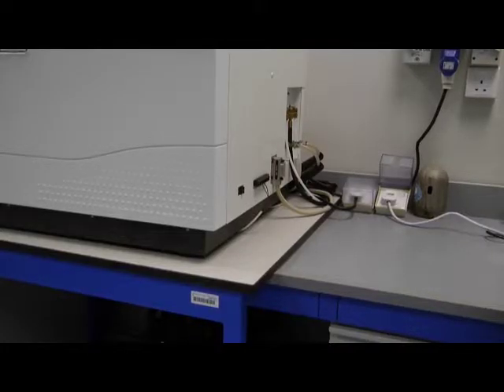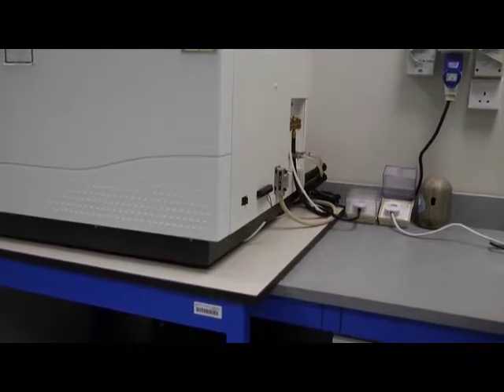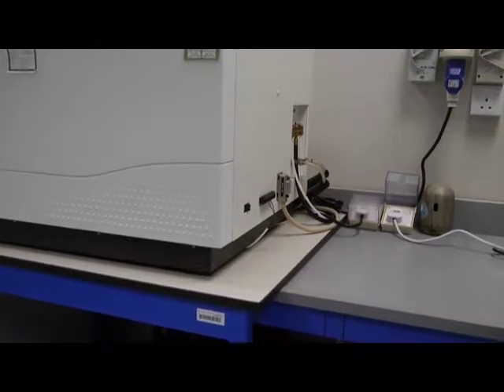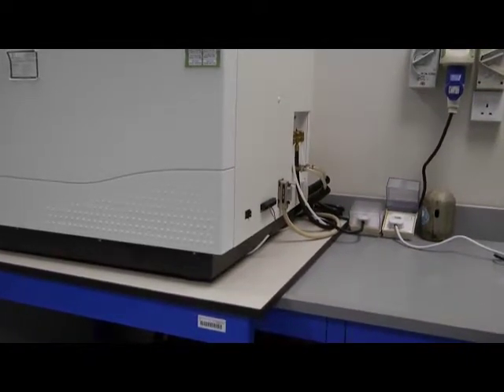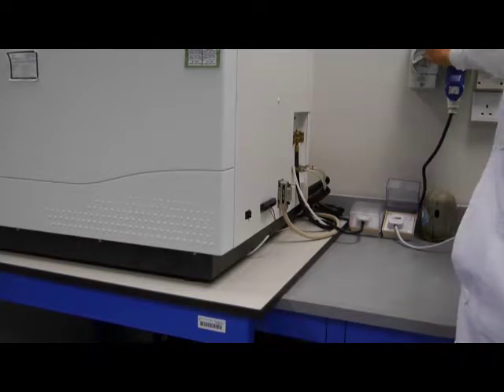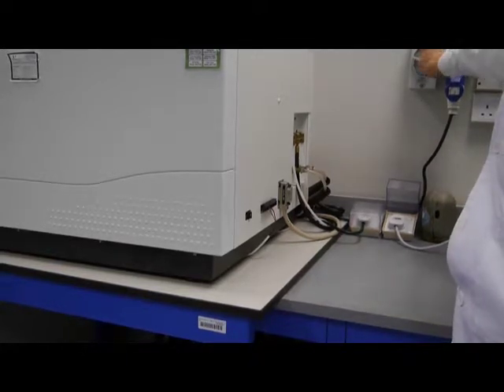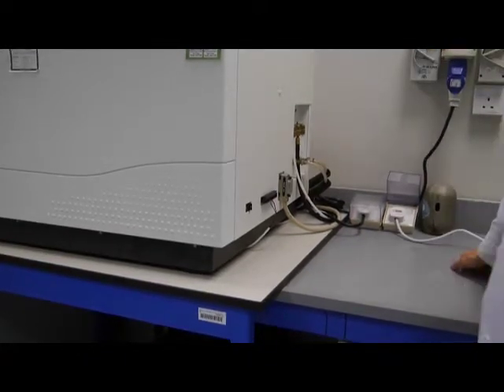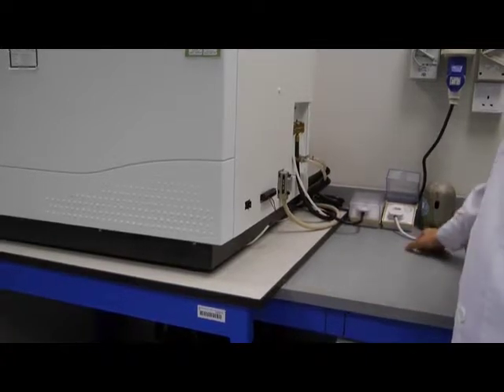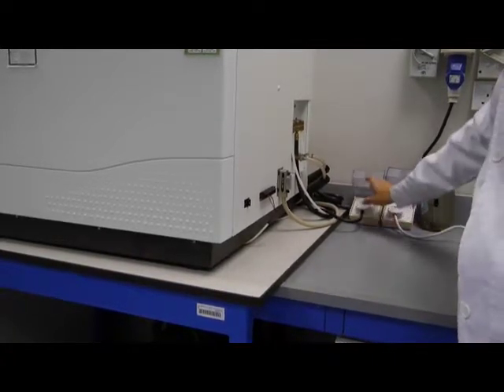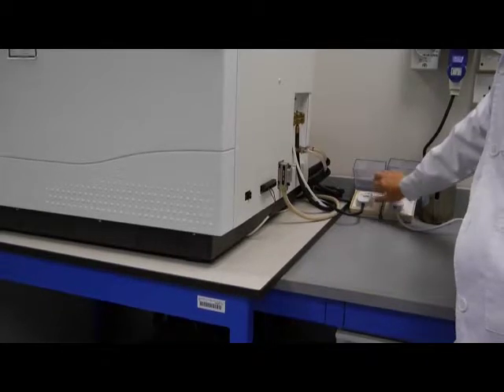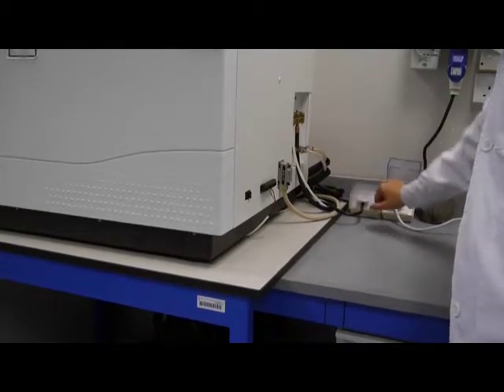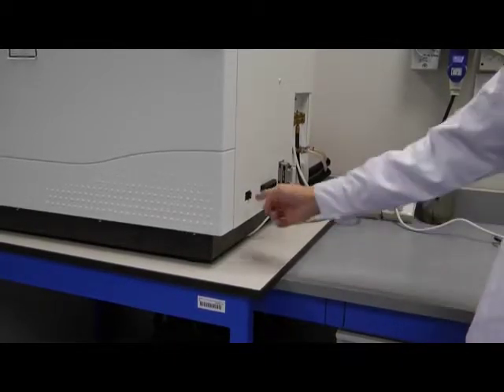After the gas is on, now you have to turn on the power. First one is the main switch for the ICP. Next one is the switch for the chiller. The last one is the switch for the equipment.